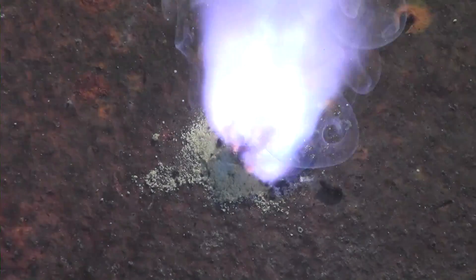You can test it by adding equal parts of potassium nitrate, sugar, and the copper chloride, and igniting.